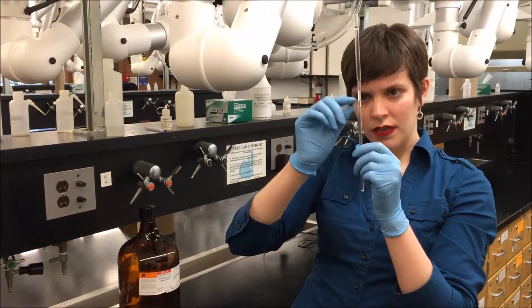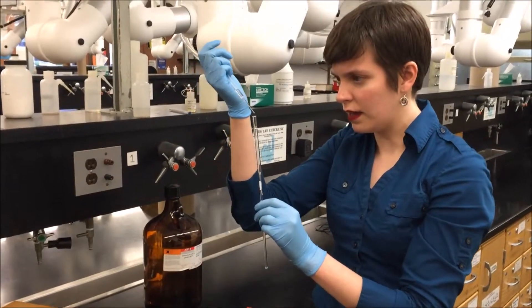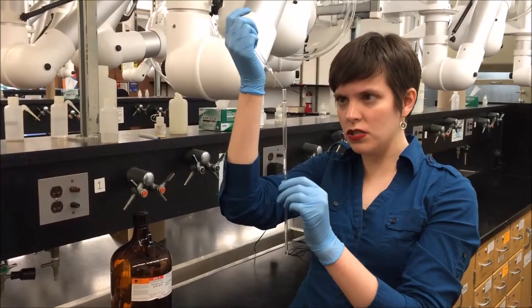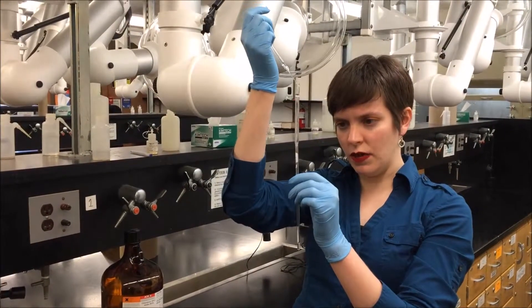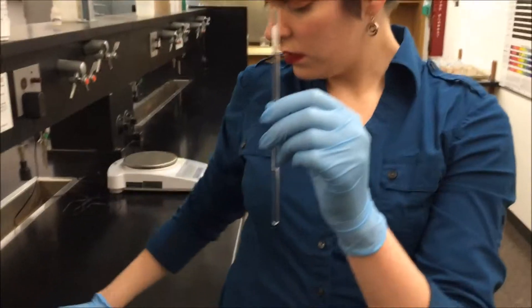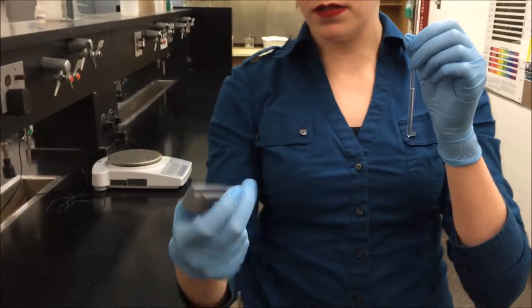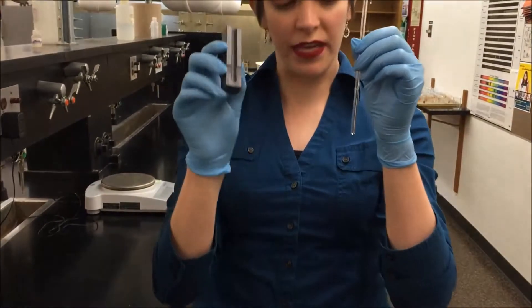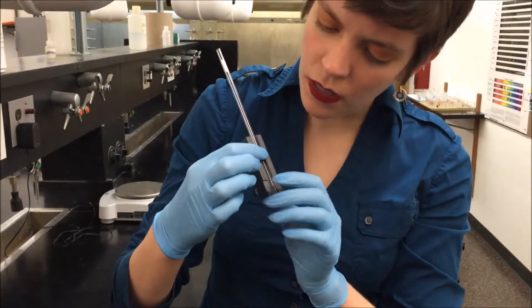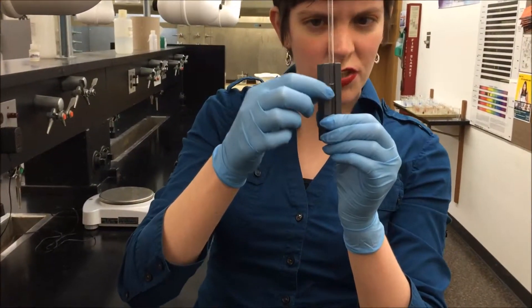So now I've got some of it in solution and some of it's still in here. I'm just going to keep doing that slowly — add a little bit of chloroform and let it run through, carrying the benzoic acid down and dissolving a little more at a time. So I've got everything in there. This is our depth gauge for the NMR, and I want to get my solvent level to be somewhere around the top of it or a little higher, just to be extra sure.